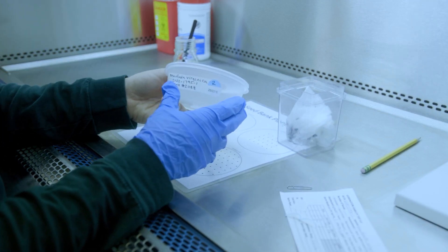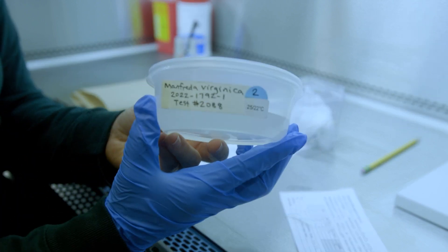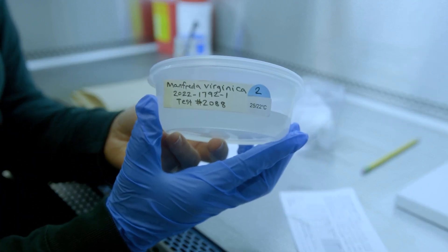The label is placed onto the plate. Then I place a sticker that corresponds with the next temperature treatment the test will need and the week that it will need to be moved.